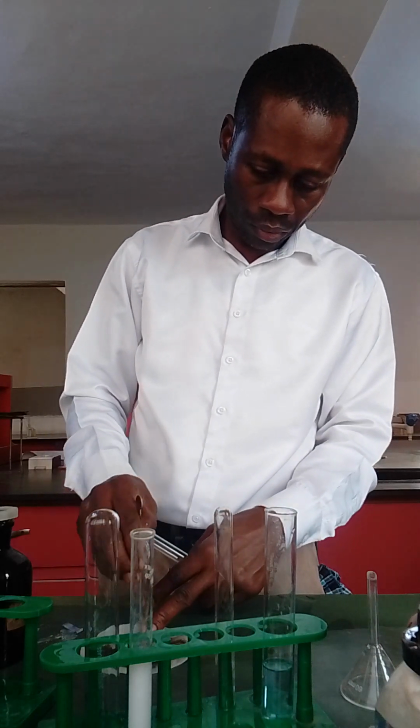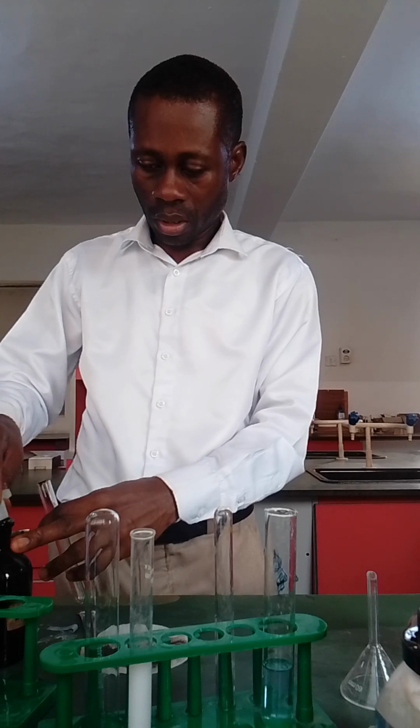residue. So you take your spatula and take a small collection of the residue, just as small as you can gather. Okay, this residue is not residuing, so you just get some. All right. Okay, so you just have to add a little dilute HCl. Just add dilute HCl to it.